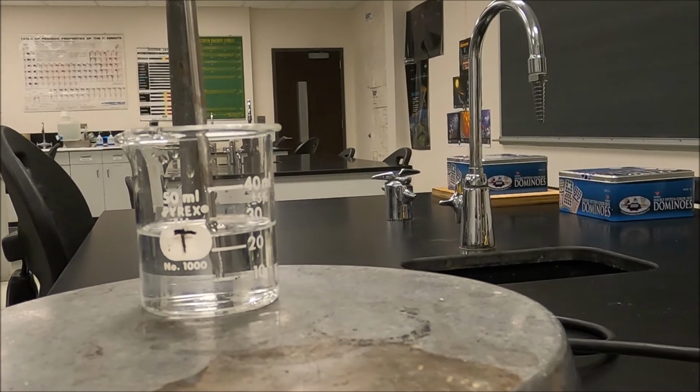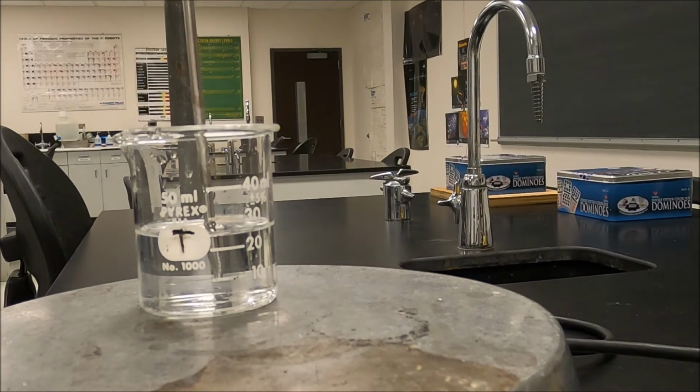Okay, I know, it's really exciting. Now, while you guys are watching that boil, I'm going to sweep up the broken glassware, because I don't want anybody getting hurt that's coming into my lab. It's just not a good idea to have broken glass hanging around.